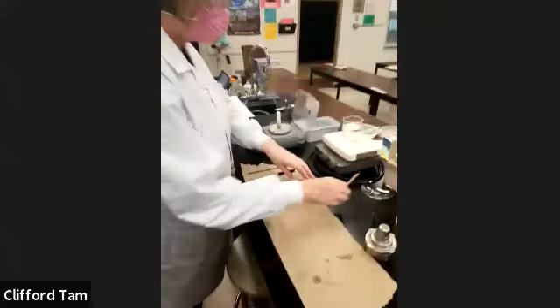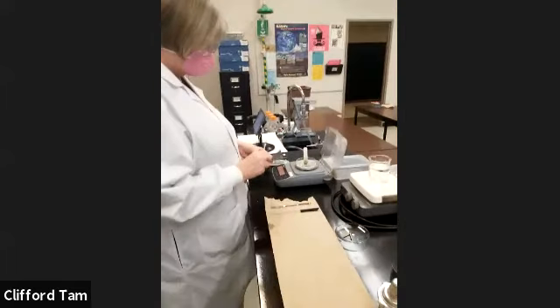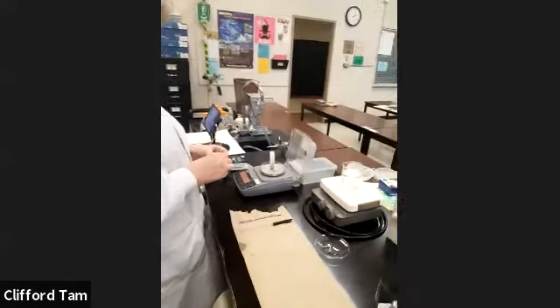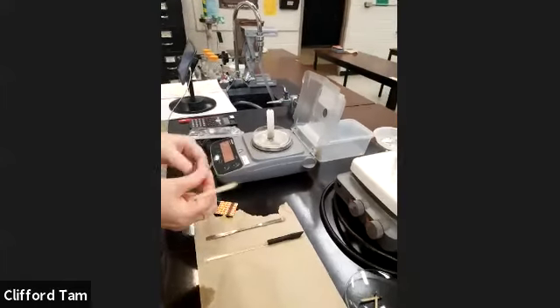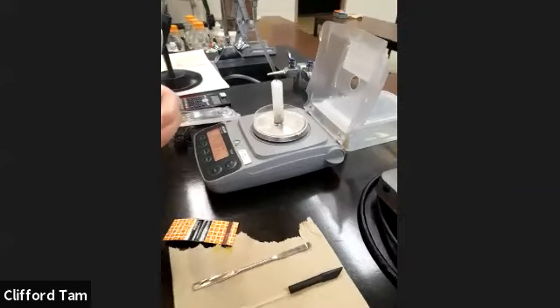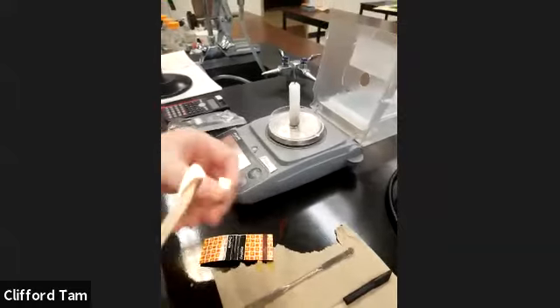Okay, guys, so here we are today. Xantha and I are basically here to demonstrate the 4 other factors that influence reaction rates. What Xantha is doing is massing out the candle before we start burning it. What you guys are going to notice in terms of numbers is around 24.788 or 89, okay?